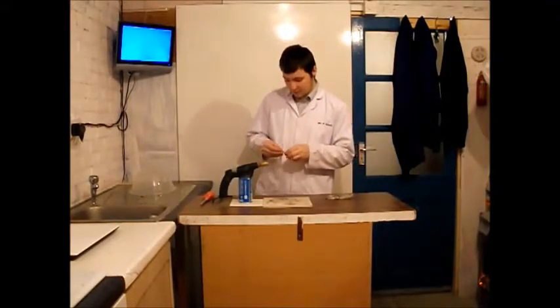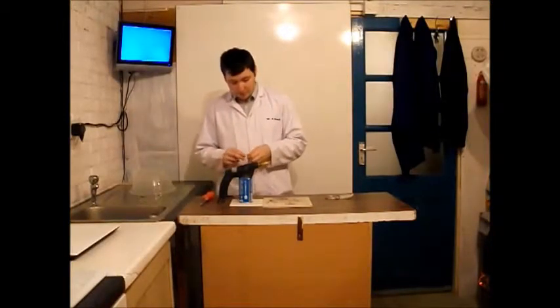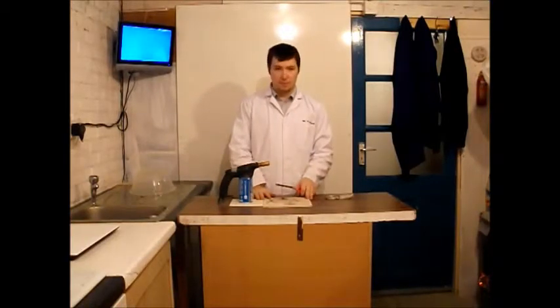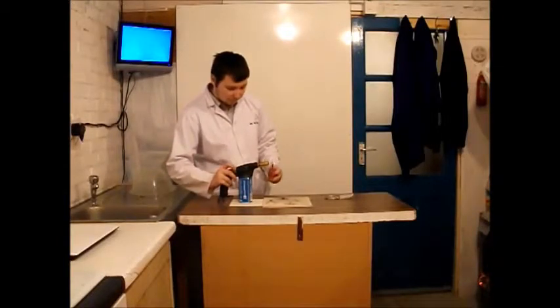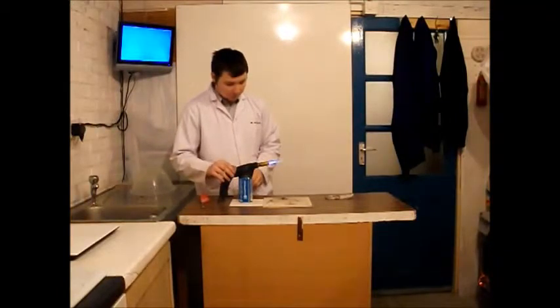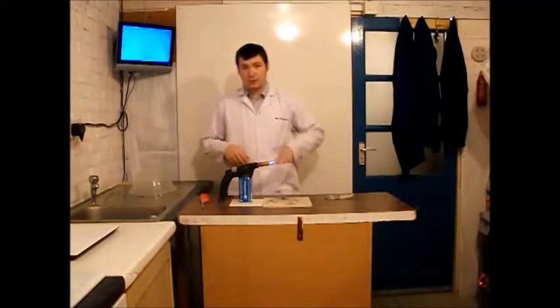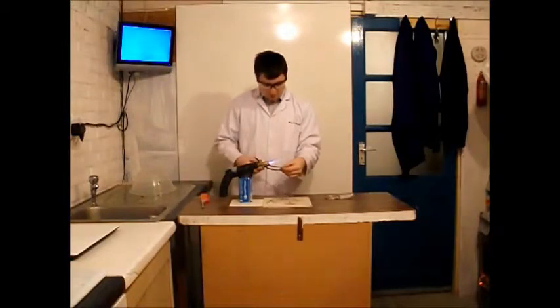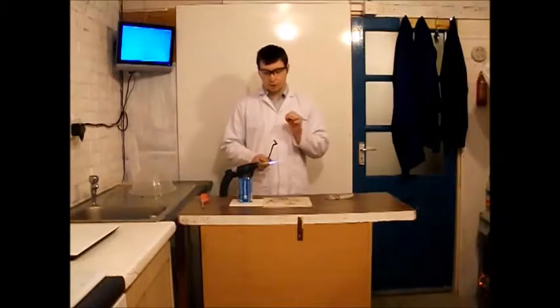So if I fold it up a bit — this is actually quite a lot that I am doing this time — then make sure you are doing anything like this over a heatproof mat. But you are not going to try this one at home, ok? So you just need a little flame. Obviously, you need to be wearing safety glasses, and you are taught not to look directly at this, so I am not going to.